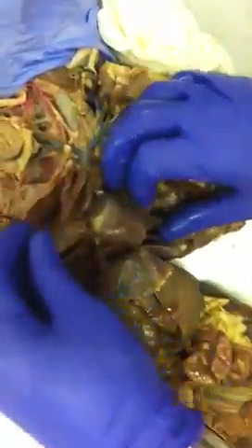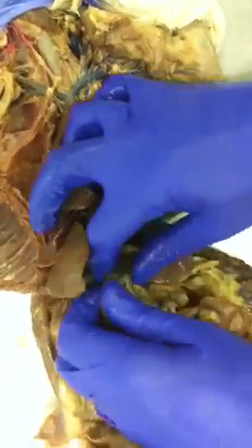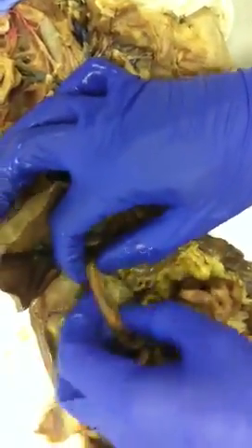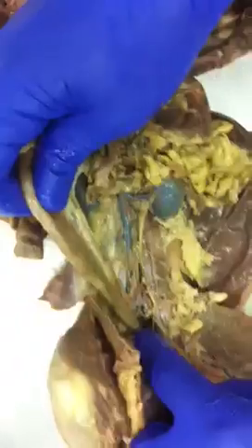All right, you have heart, lungs, diaphragm, liver, gallbladder, bile duct in here. So this is the stomach. Right after the stomach would be the duodenum. So underneath duodenum, or kind of on the underside of it, this grainy looking gland, that's pancreas. So from duodenum into jejunum, that's this. Just further along, the end point of the small intestine is ileum. So here, right before you see the cecum. So cecum, ascending, transverse, and descending colon.